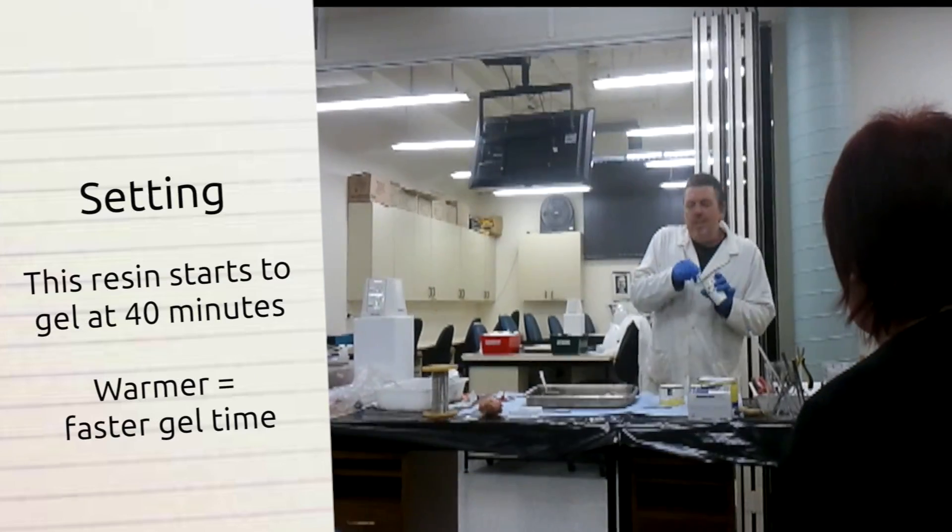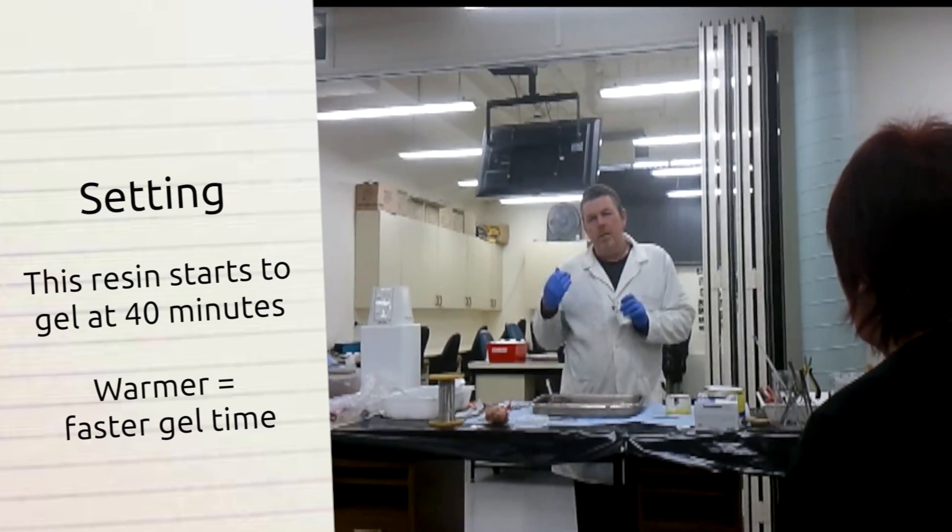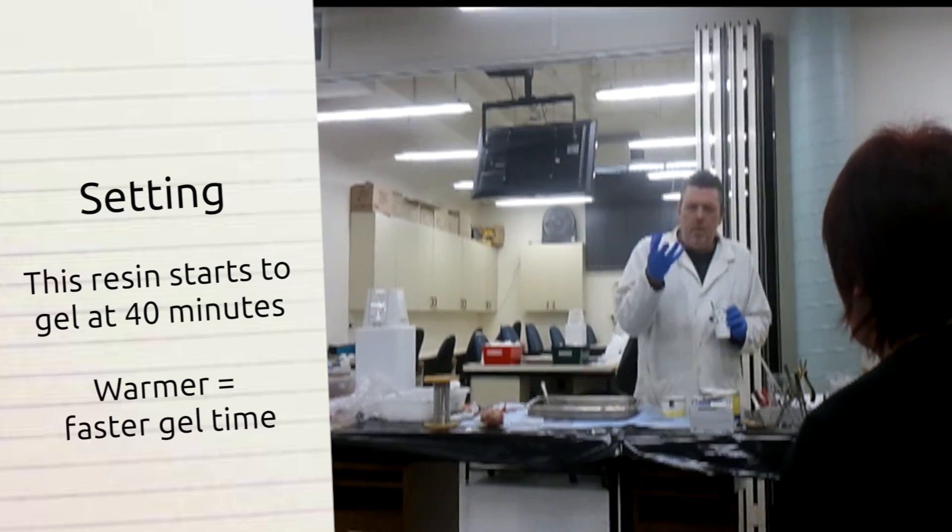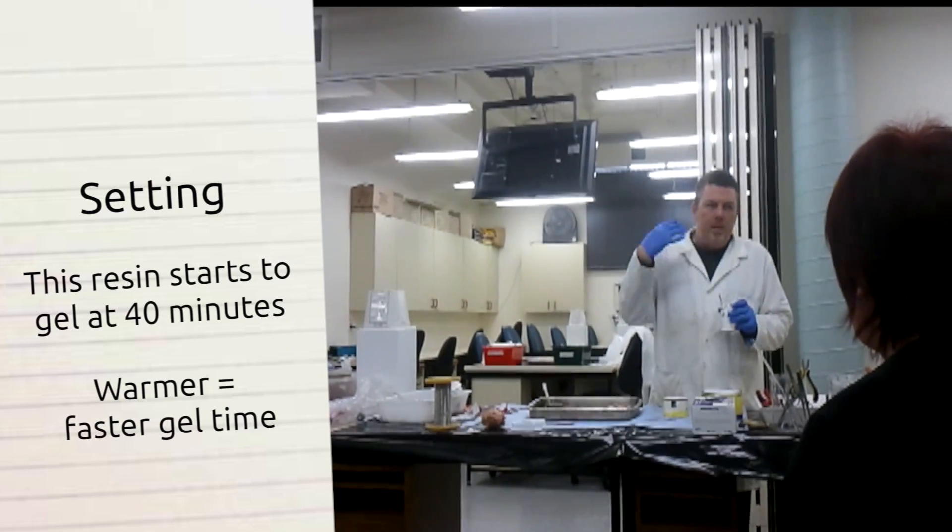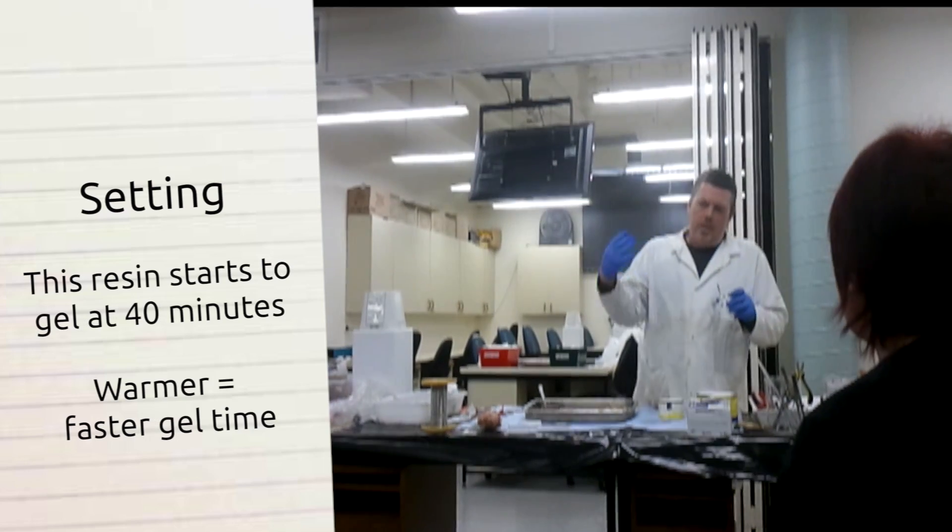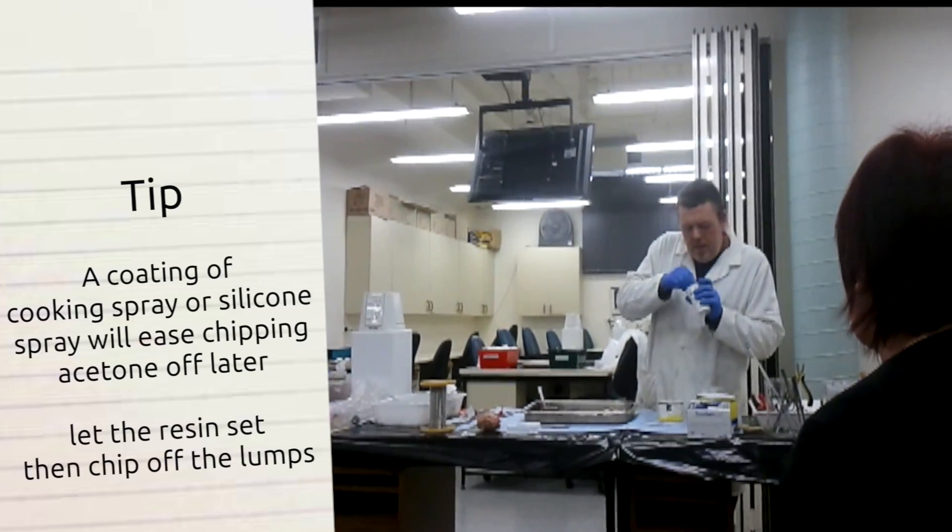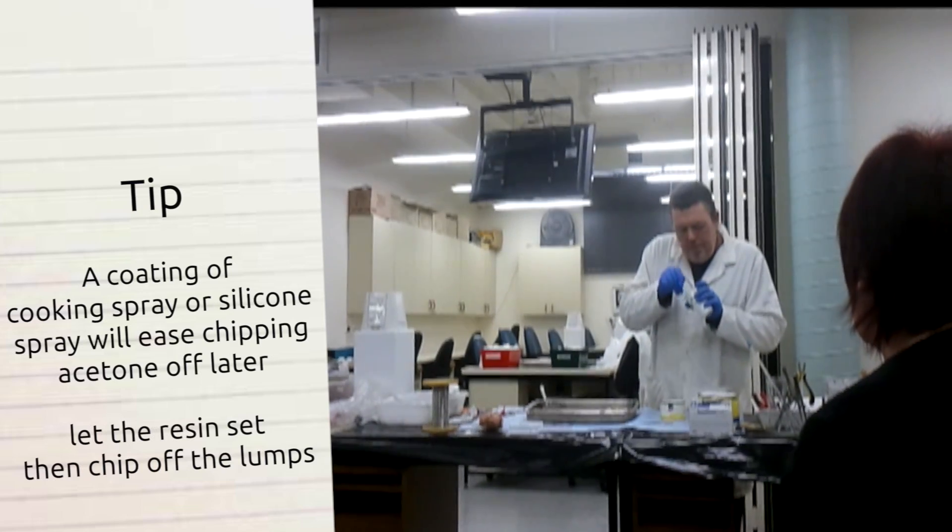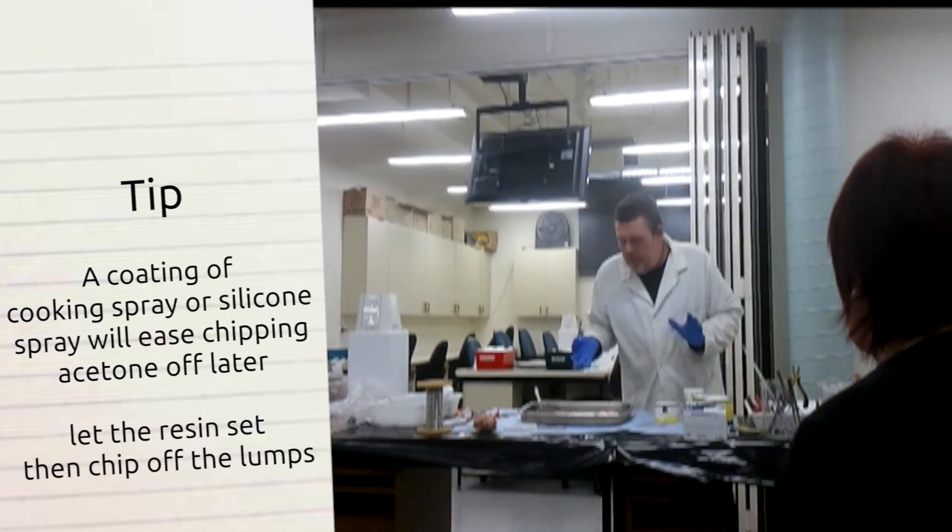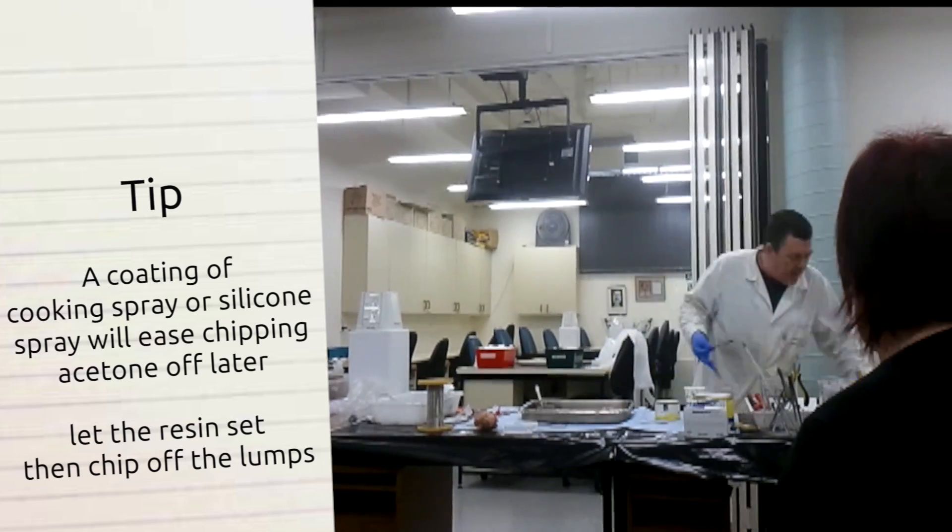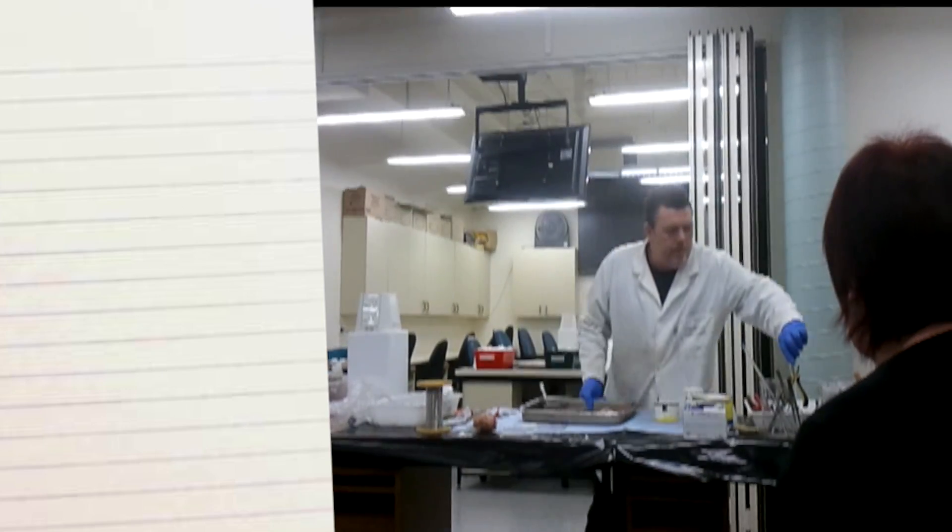One of the dangers, actually, with the resins is once you've got the resin in and it's hit its gel time, you don't want to handle them. Any movement of the organ is nice and flexible. You're basically undermining the structure of the resin trying to set inside. So one of the benefits of this is having such a short working time. Having a reasonable working time, the benefit is that it'll set hard that much sooner and you run less risk of downtime.